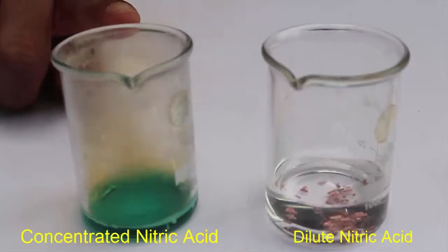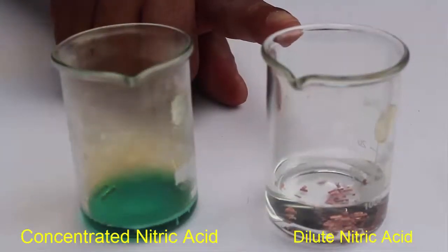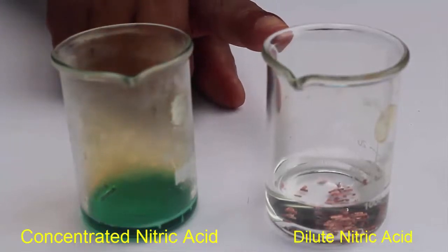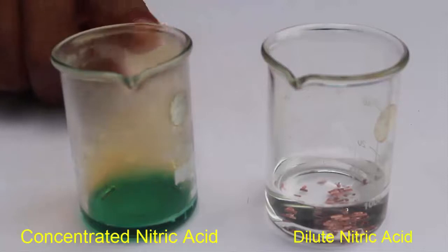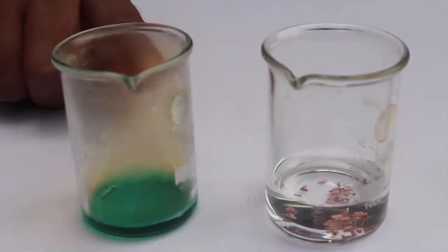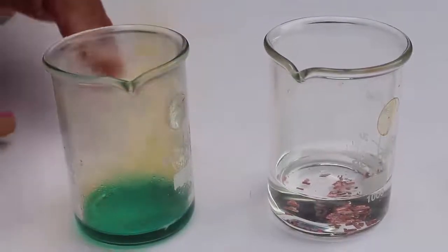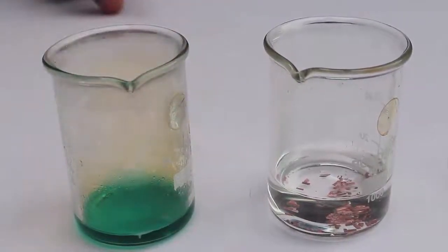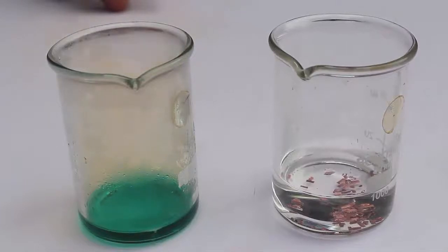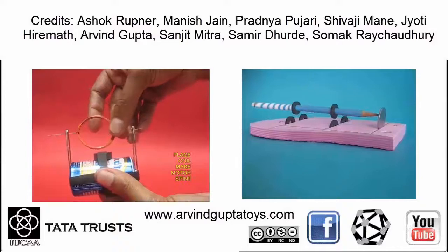It will take a little time before the reaction starts in the second beaker, but in the first beaker the reaction is almost over. You can see all the copper flakes have dissolved in the concentrated nitric acid, leaving behind a very beautiful green colored solution of copper nitrate. So the green liquid is actually copper nitrate. Isn't this a fun experiment! In chemistry, you must always do this experiment under adult supervision.